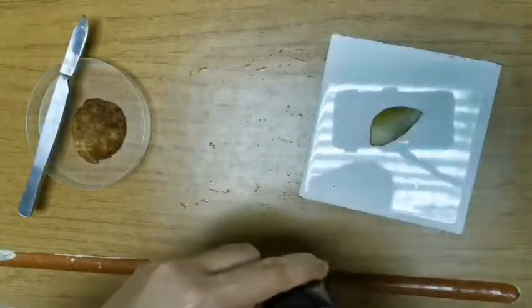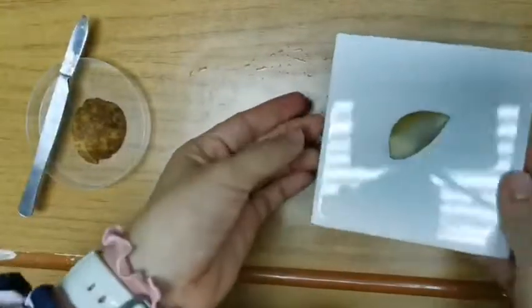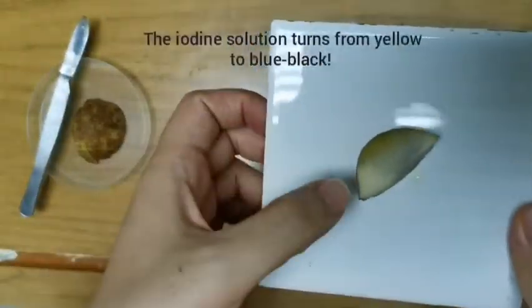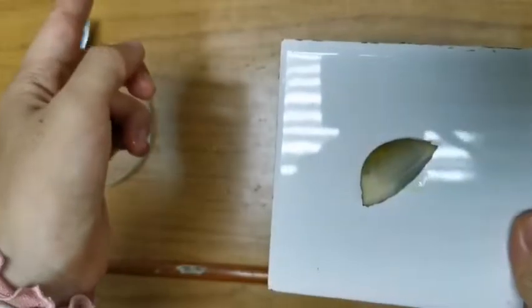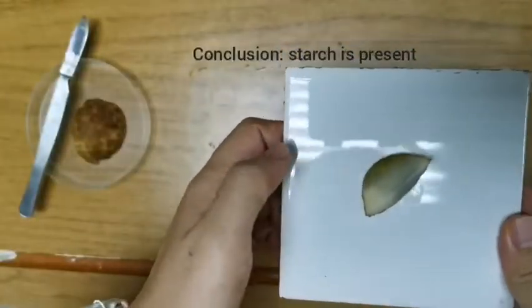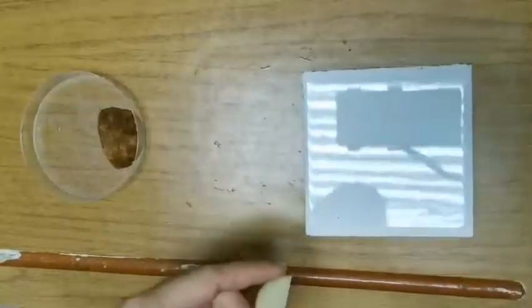So what do we notice here? You can see the blue-black colorations. In the presence of starch, iodine solution has turned from yellow to blue-black. So I can say that potato contains starch.